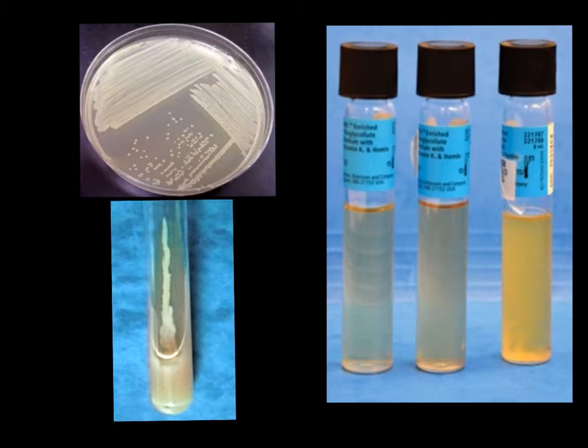We will begin with the procedure dealing with bacteria from colonies either collected from a petri dish or an agar slant.